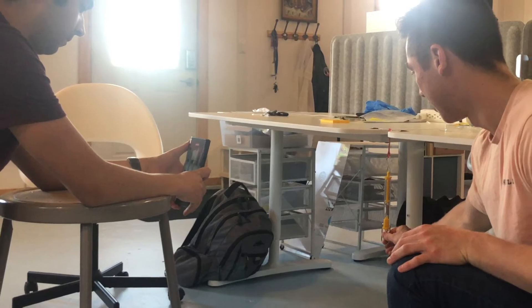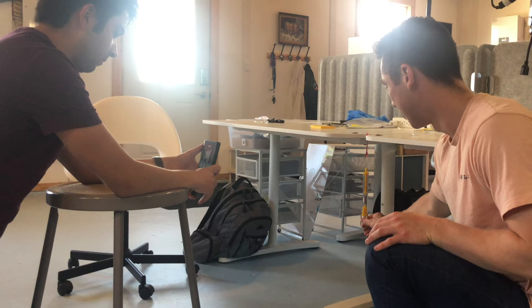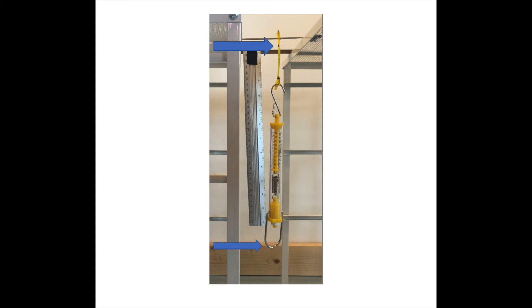Have your partner set up three feet away from the hanging bioplastic with a phone to record the experiment. It is very important that the phone holder rests their hands on a stool or chair so that the frame in the video remains still. Make sure that the video captures the top of the dumbbell and the bottom of the force meter. If not, readjust by backing up.